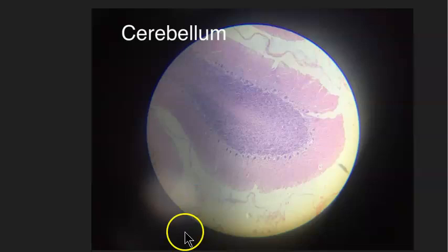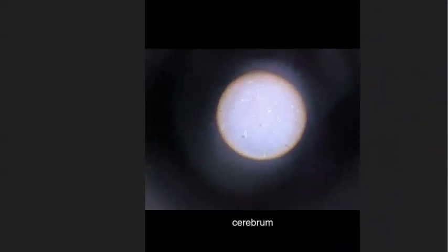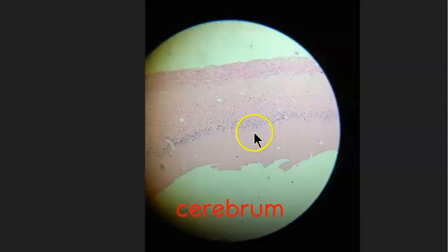Cerebellum. Okay. Here's another slide of cerebellum. You can see how patterned and purpley and pink it is, right? Cerebellum. What is this? Again from C. So this is cerebrum. Okay. Cerebrum.